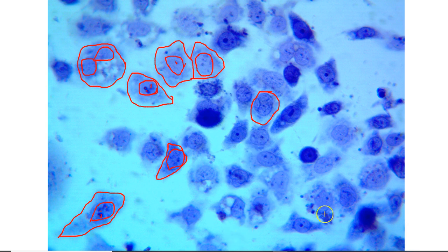And then you can look over here and you see some dead bodies, remnants of cells that have undergone apoptosis. Here is another one that is going through apoptosis right now. You can see the blebs forming all over the place. So you have some examples of cells undergoing apoptosis and dying through it. You also see some dead bodies scattered here and there. So some cells clearly have already died through apoptosis in this particular slide.